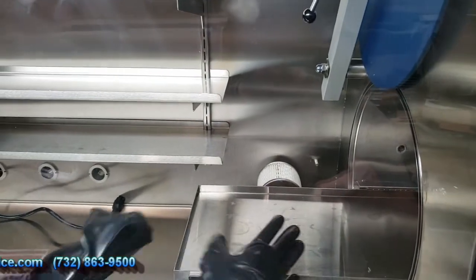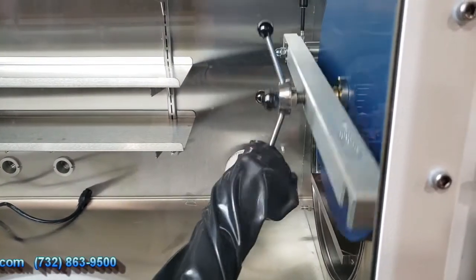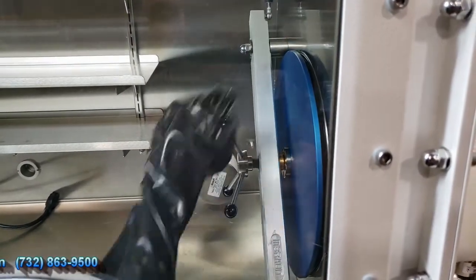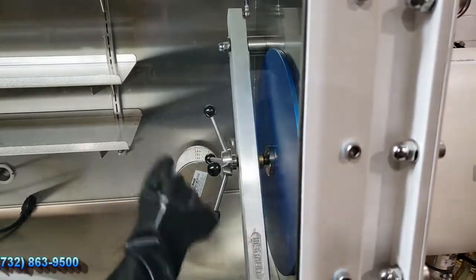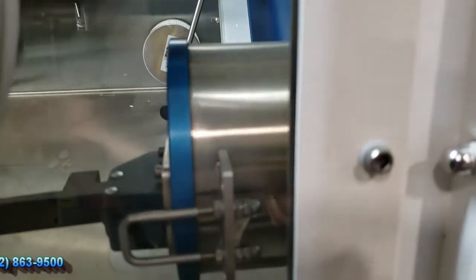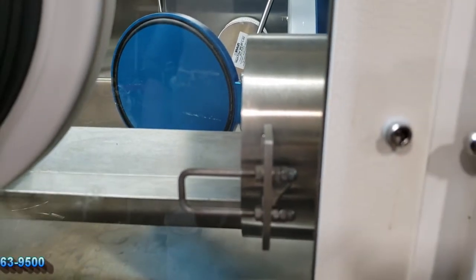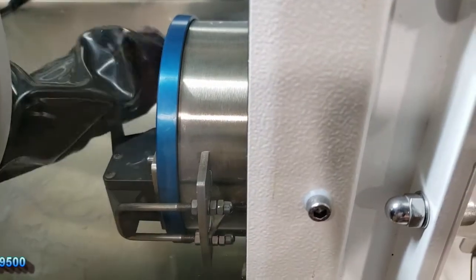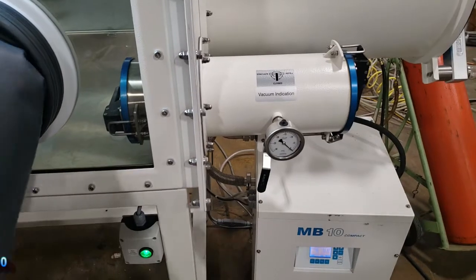As you can see, you can slide your work in and put it inside the glove box. When you're done you want to go ahead and close the door. Just make sure the shelf is all the way in. Bring that down and plug it up. And the same with the smaller antechamber. If you're doing small work you need to introduce it to the glove box and you have to take it out of the box, then close that up and lock that down. Okay, that's our demonstration of the glove box.